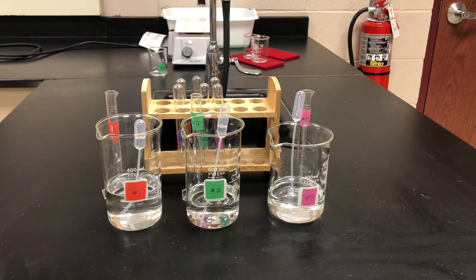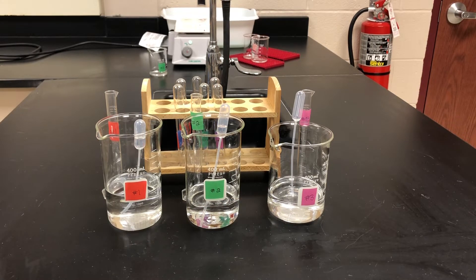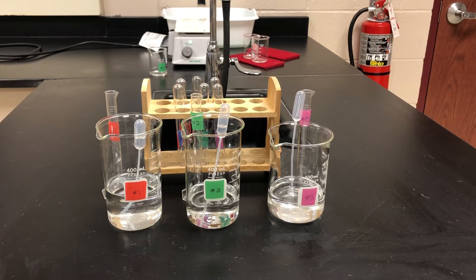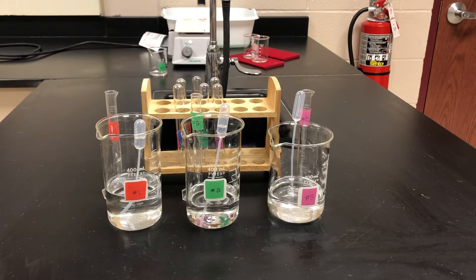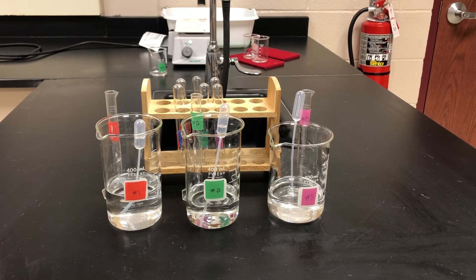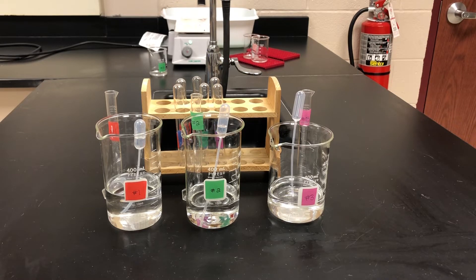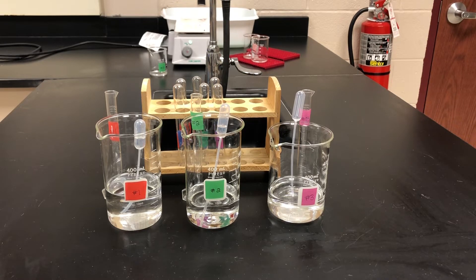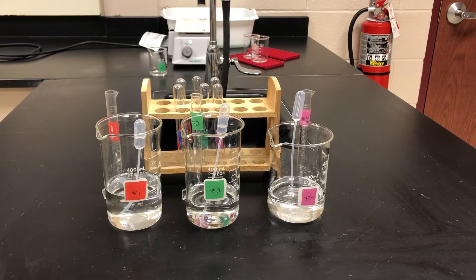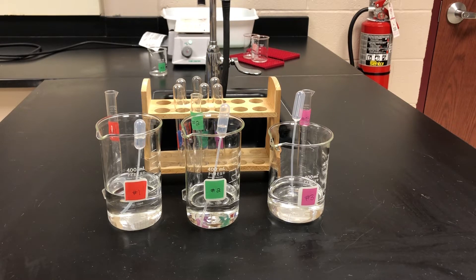Some of these tests have already been performed for you and the results have been recorded in the data table provided to you in your window. The following tests will be experimented and filmed, which include boiling point, solubility of sugar, solubility of oil, and flammability.